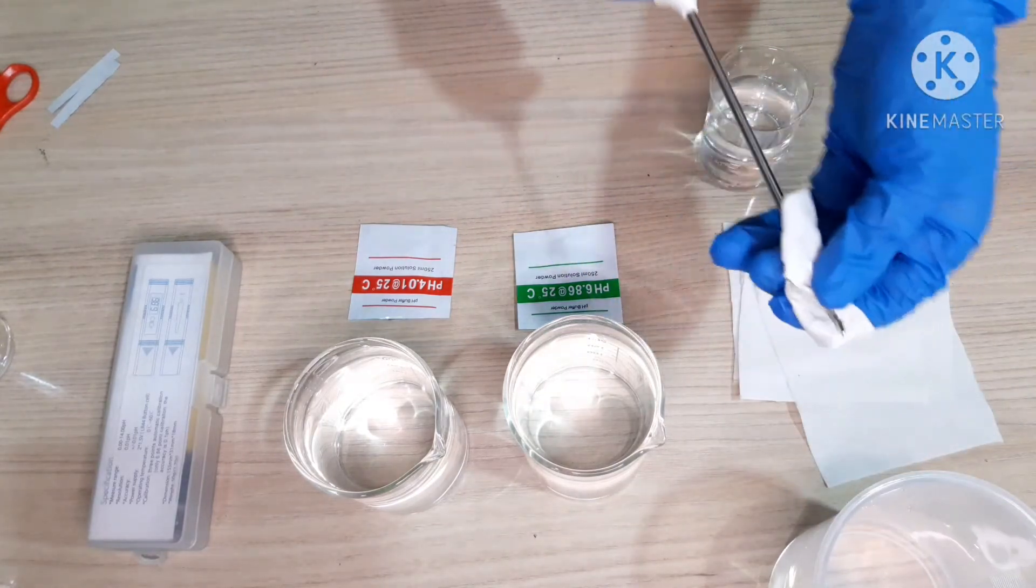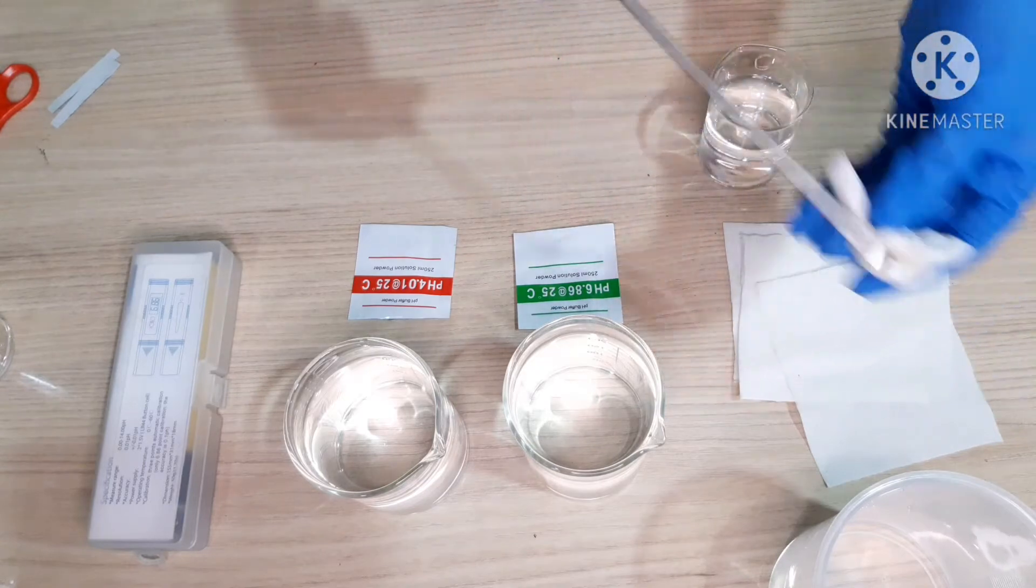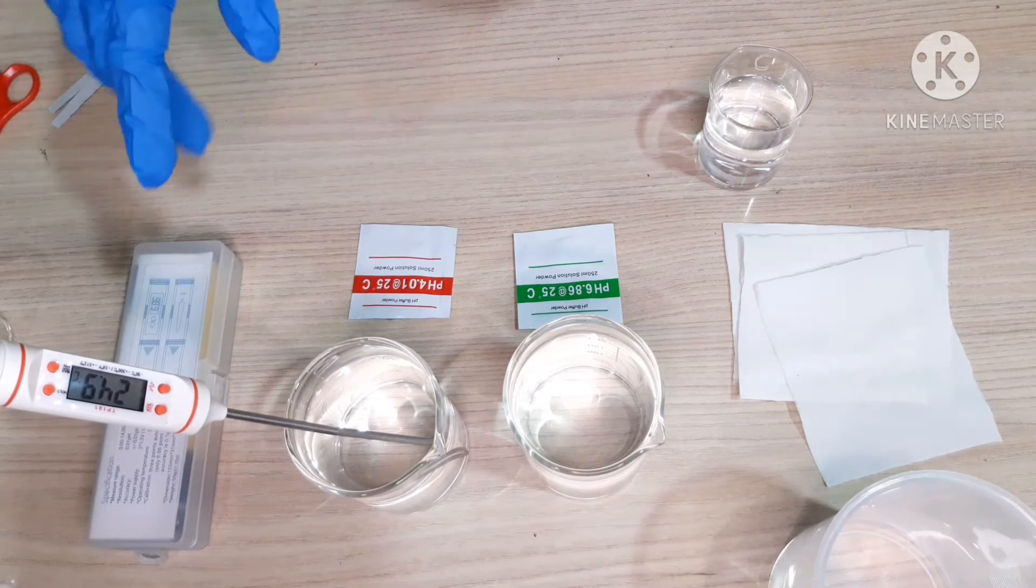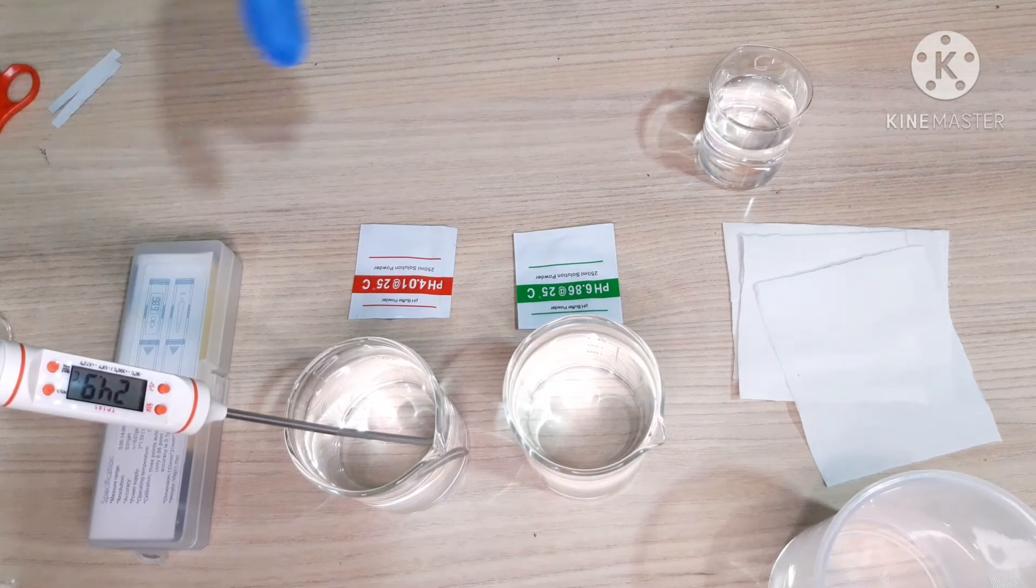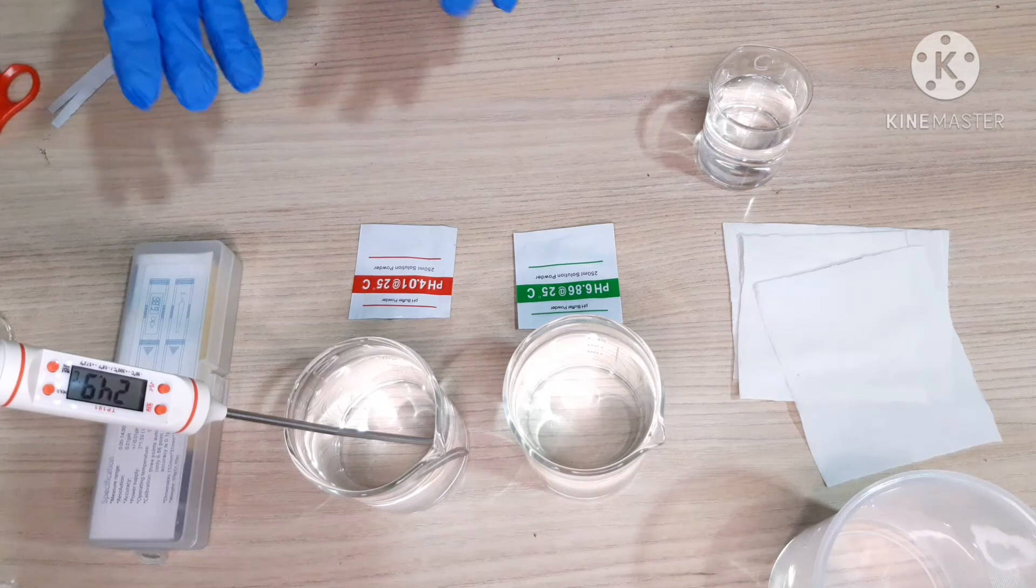I have rinsed it with distilled water and wiped it off before putting it into another solution. This is at 24.9 degree centigrade which is around 25 degrees. So, we are good to measure it. Calibrate the pH now.